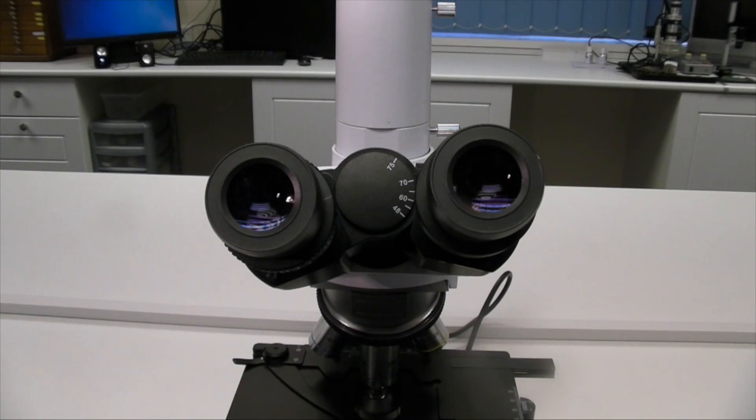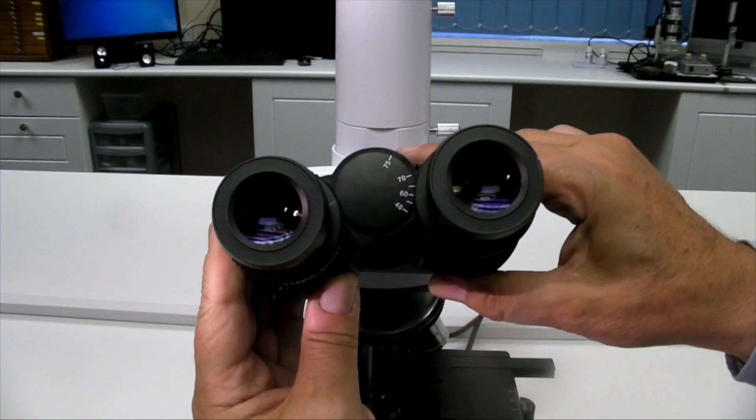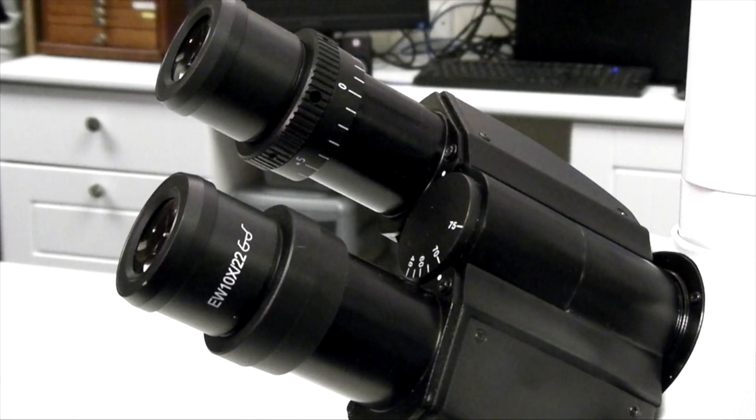The scale is used to set the correct distance in millimeters between the eyes. In this example, the scale runs from 48 to 75. Taking time to adjust this distance and to remember the scale reading allows microscopes to be adjusted for your personal distance immediately.